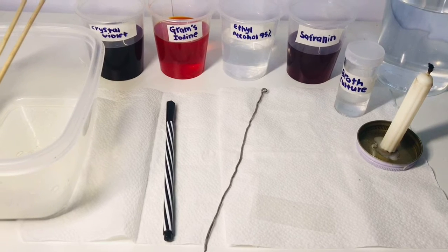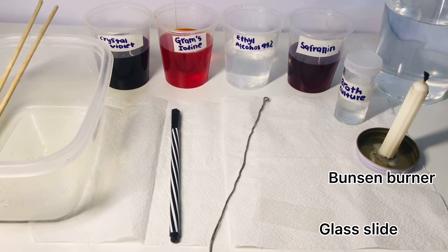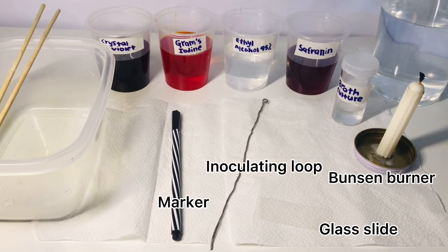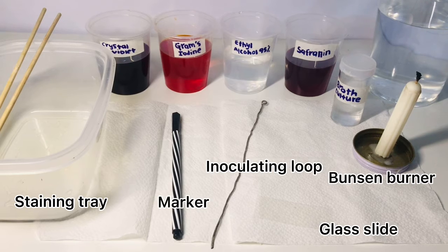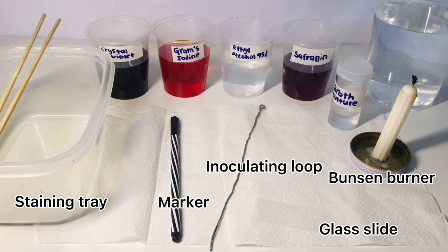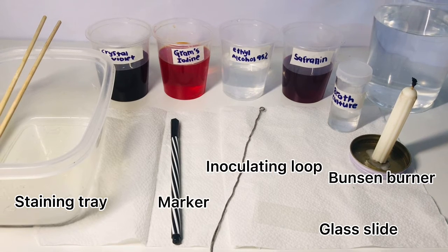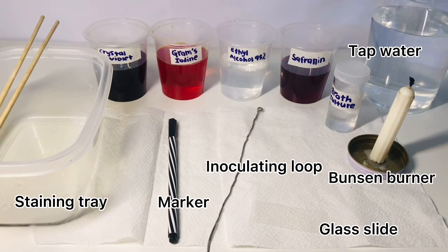The materials needed for this experiment are glass slide, Bunsen burner, inoculating loop, marker, staining tray, crystal violet, Gram's iodine, ethyl alcohol 95%, safranin, broth culture, and tap water.